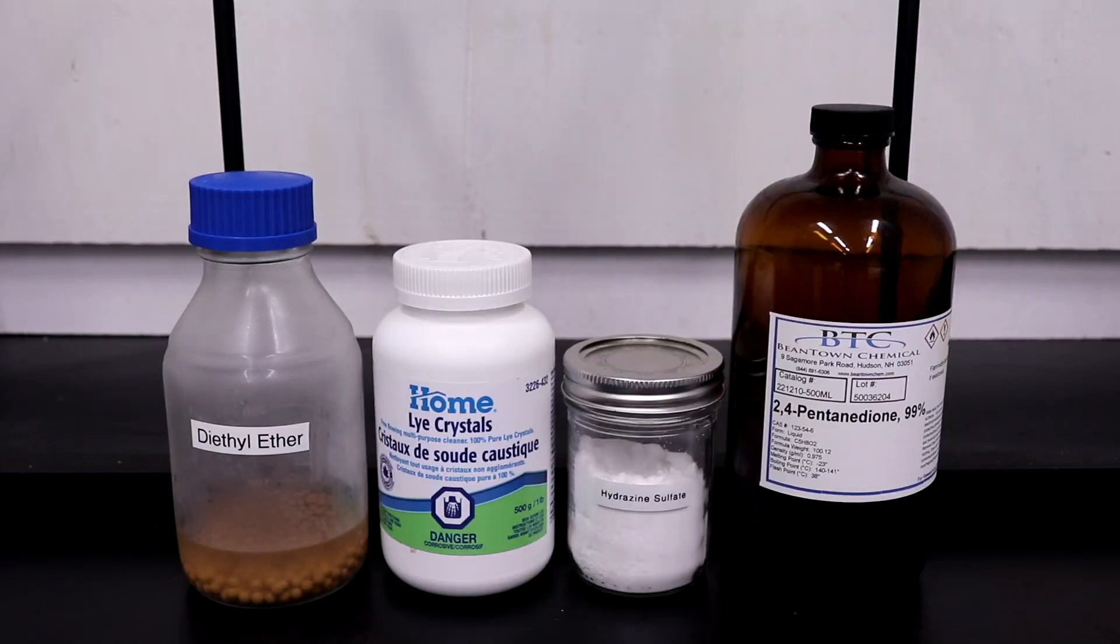The synthesis requires 130 milliliters of diethyl ether, 20 grams of sodium hydroxide, 32.5 grams of hydrazine sulfate, and 25 grams of acetylacetone, which is 2,4-pentanedione.